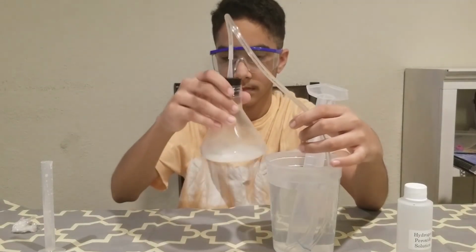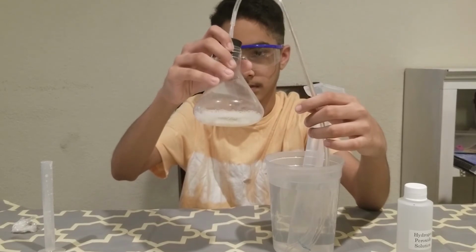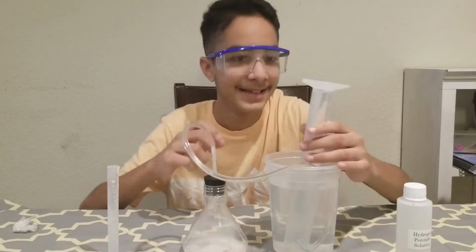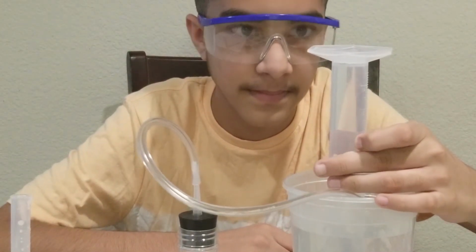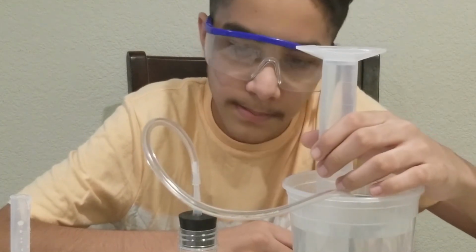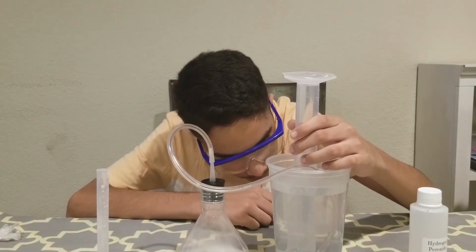Okay, so you should see the gas bubbles coming into the cylinder, and you can see, Shahyan, if you hold the cylinder vertical, you can leave this Erlenmeyer flask on the floor. Okay. If you keep it vertical, now you can see that there is air, right? And that air is the oxygen gas coming. And if you look at the tubing at the bottom, it's just difficult to zoom in. But if you look at the tubing, you can see the oxygen gas bubbles coming out.